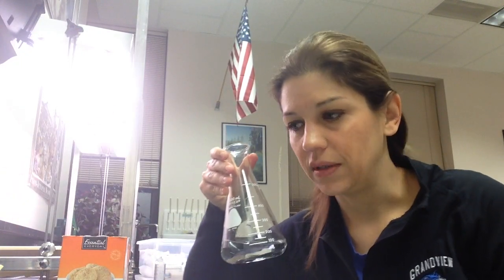Your procedures say to prepare 900 milliliters of it, but I think it's easier to do it in 450 milliliter increments using a 500 milliliter Erlenmeyer flask — just do it in two separate sets. Remember when preparing a 0.2% solution that it's by mass: calculate 0.2% of 450 milliliters, measure that out in grams on the balance, then add water to reach 450 milliliters. For this lab it doesn't matter if you use DI water, so we'll use tap water since it's easier.